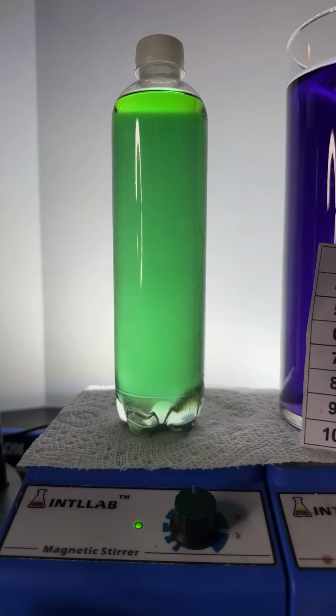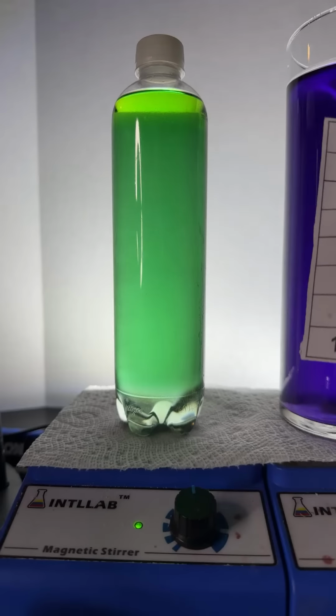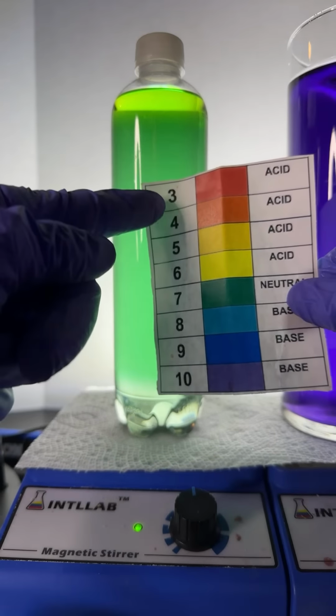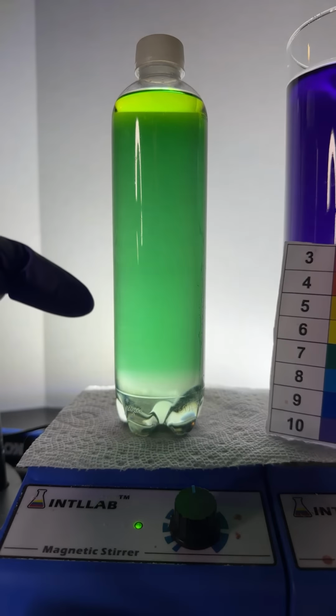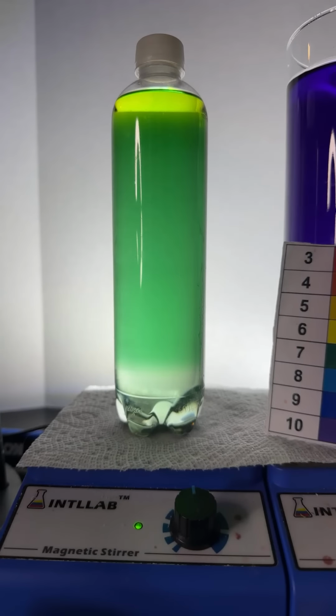PG Dub, I don't know how I got all those colors, to be honest with you. I've never seen it oscillate like that, so I don't know if you all noticed, but when we first shook this up, I saw it go like red, but then it just kind of shifted back this way, which is really interesting. I don't even know. I'm not even going to take a guess, because I don't know what the heck's going on.